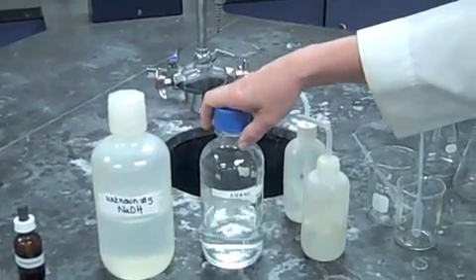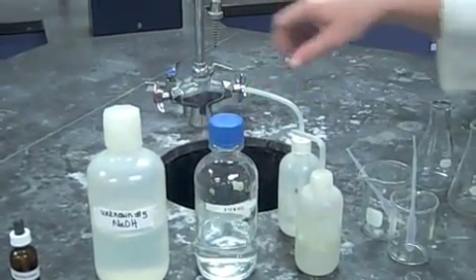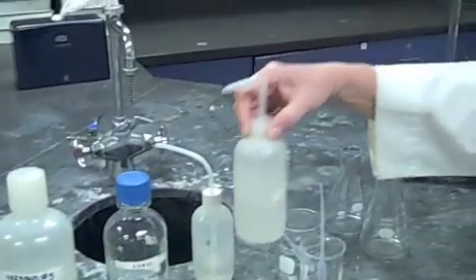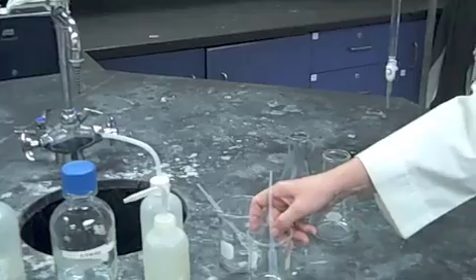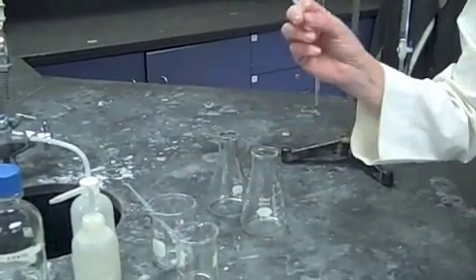You'll need some 0.1 molar HCl, one or two distilled water wash bottles, a couple of waste beakers, and pipettes labeled A for acid and B for base.